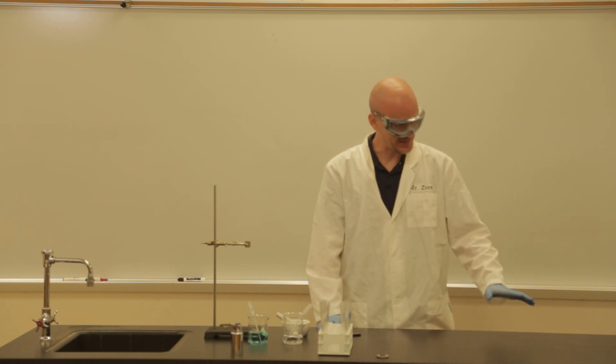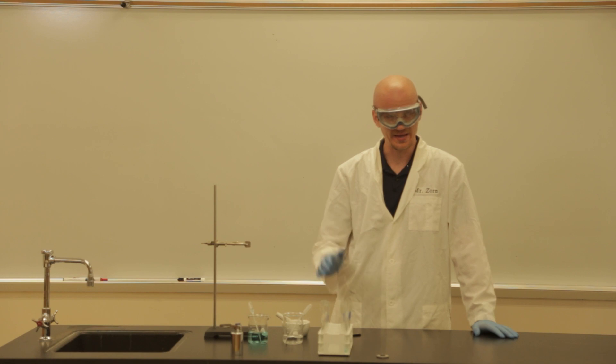In this lab, we're going to look at a couple of samples, and we're going to identify them as either a metal, non-metal, or metalloid.